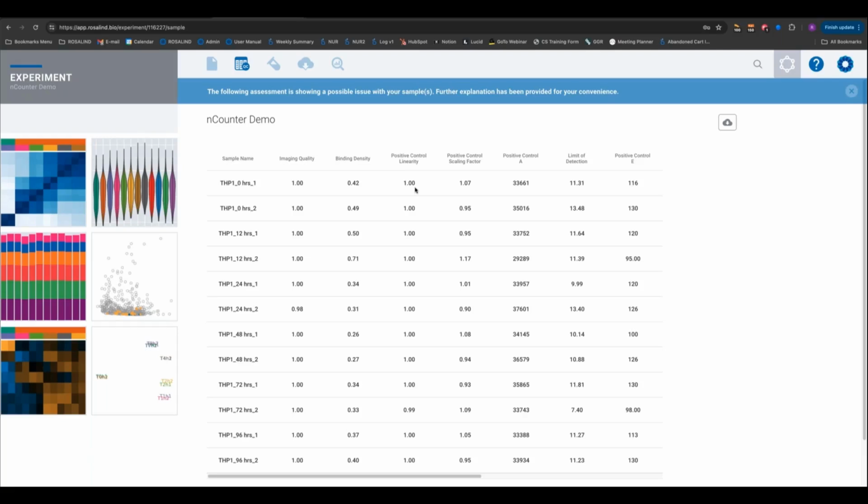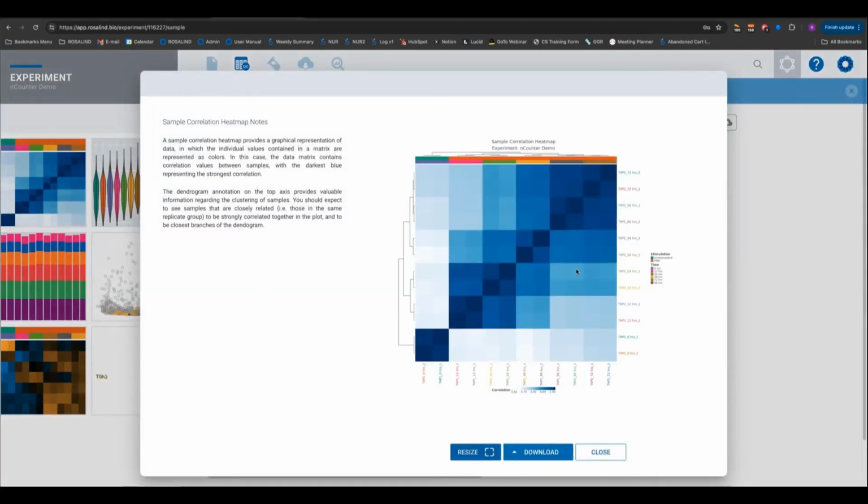Okay, awesome. One more question. What QC plots does Rosalind provide? Sure. Those are shown here on the left-hand side, and apologies for not having enough time to go through these, but we have a nice plot that looks at the correlation of all your different samples. This is a Pearson correlation, allowing you to identify if your different biological replicates have a really strong correlation with each other and whether or not they cluster with each other.